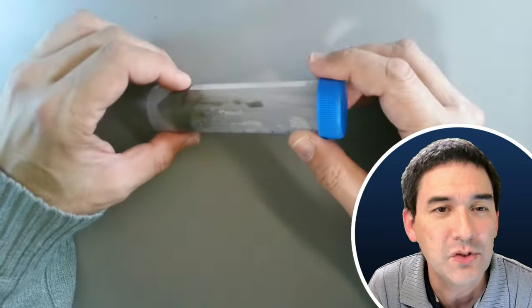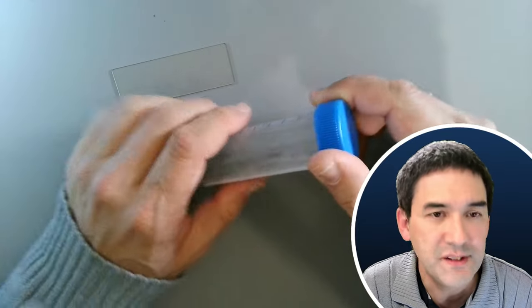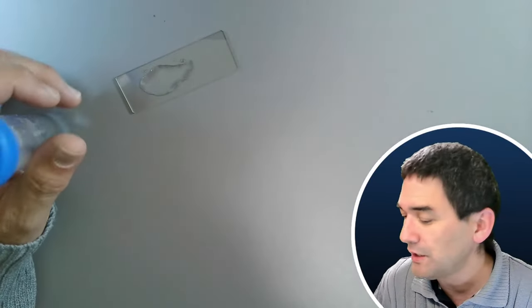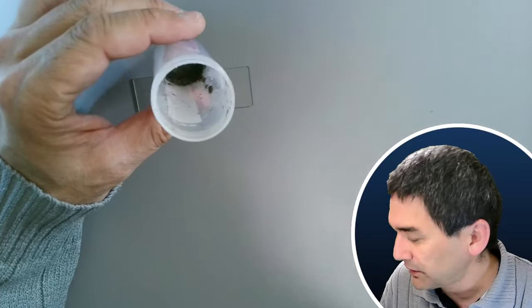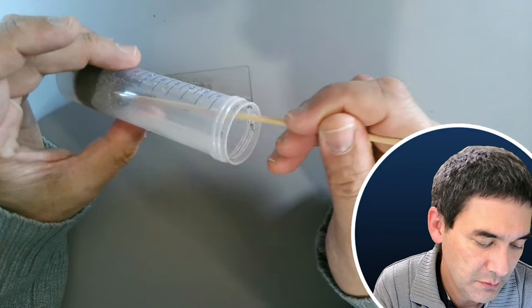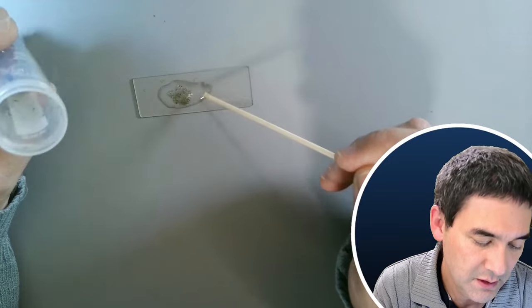Back to the desk view. I'm going to take a small sample, put a little bit of sand on a slide, and add a little drop of water. The water makes it easier to spread the sand. Using a stick I'll take a small sample. Because there's too much water, I'm going to take a tissue paper to remove the excess.